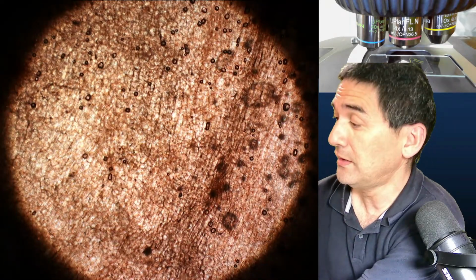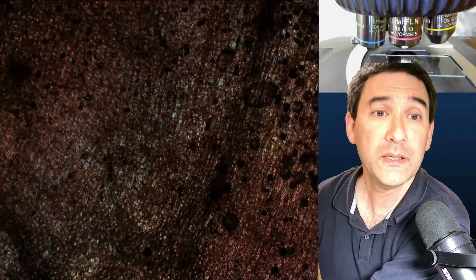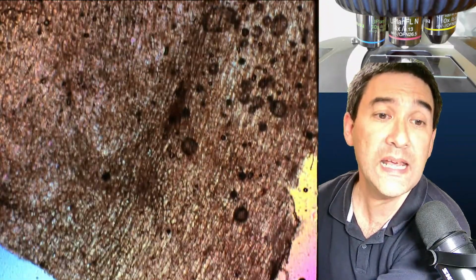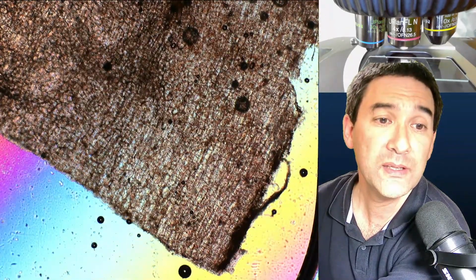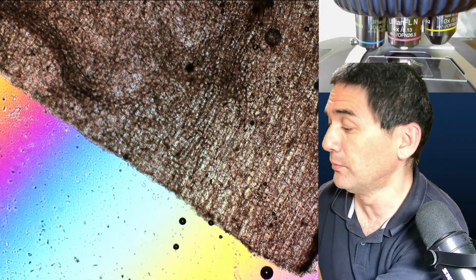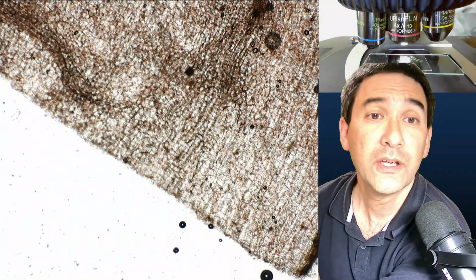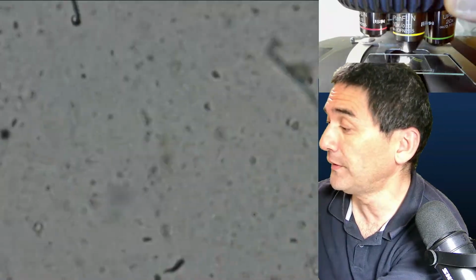But we're able to see, let me open this a little bit, but we're still able to see some bubbles in the individual cells, and usually at the edges, we're able to then see it a little bit better. So this is how the carrot looks like. Okay, let's go up a little bit with the magnification.